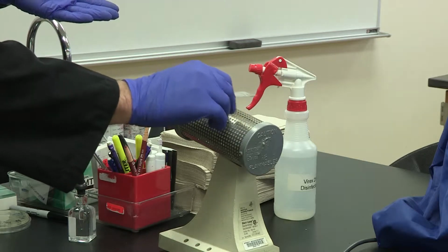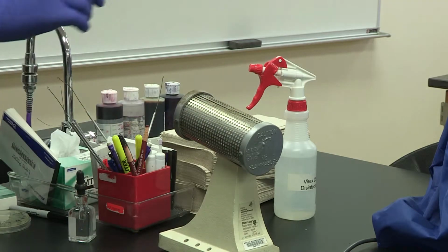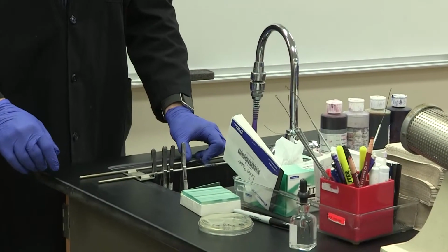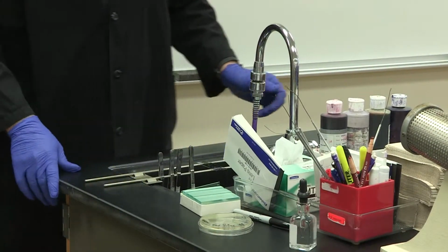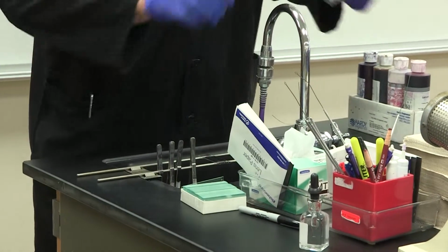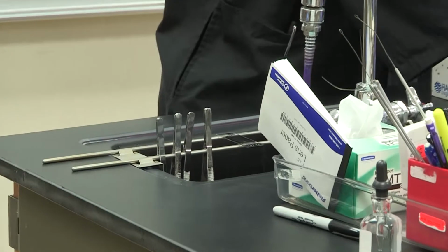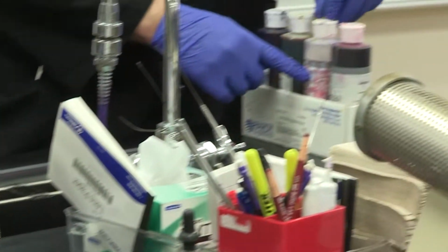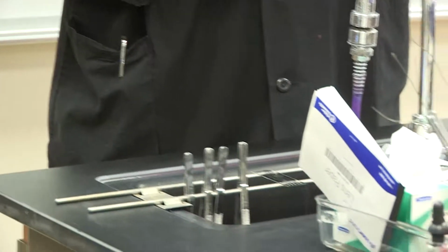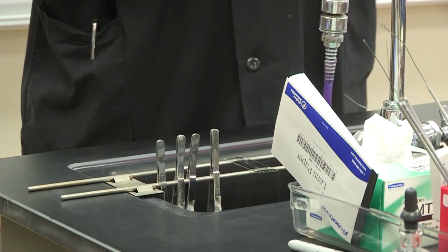Okay? Now, after about 15 to 20 seconds, you're going to come over to the ends of your desk on this sink. There's this thing called a slide rack. Now, the dyes that we're going to be using today are going to be crystal violet, iodine, alcohol, and safranin. Now, remember, alcohol and iodine are not dyes, but this is part of the gram stain procedure.